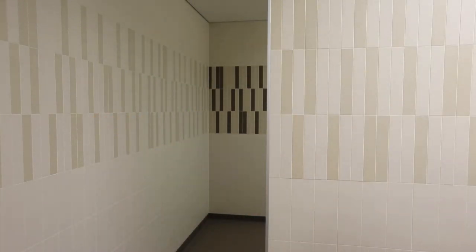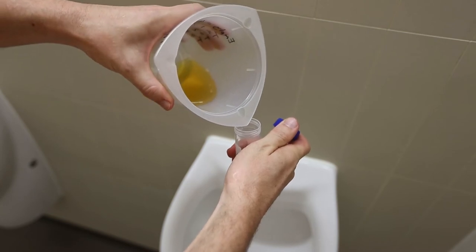Once you have weighed your empty beaker, you may collect your sample. Do this by emptying your bladder completely into the beaker. Once you have done this, for T equals 0, you then simply have to pour around 45 ml of sample into the 50 ml falcon tube.